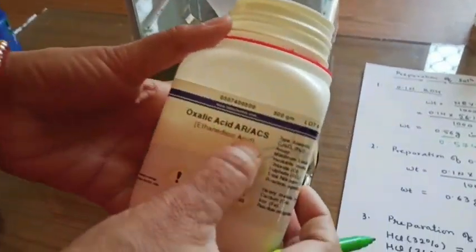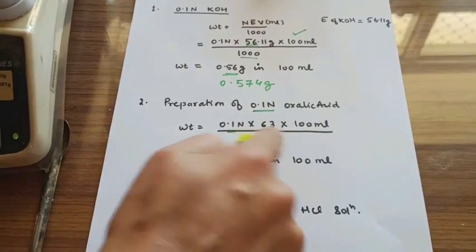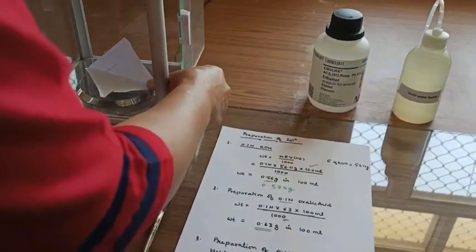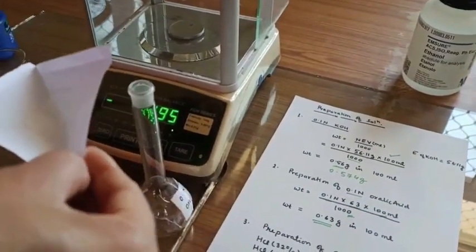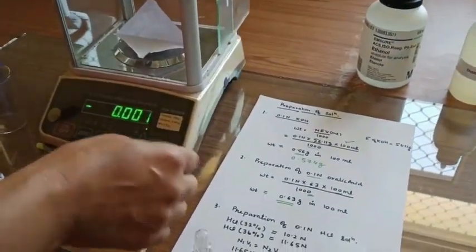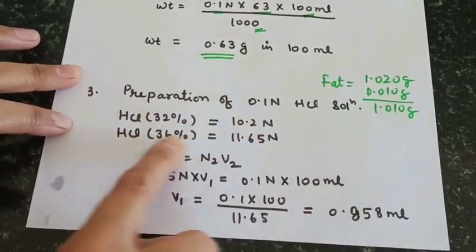Next is the weighing of oxalic acid to standardize the KOH solution. The molecular weight of oxalic acid divided by 2 gives its equivalent weight. To prepare 100 ml of 0.1 normal oxalic acid, we need to weigh 0.63 grams. We transfer it into the measuring glass with the help of a funnel, washing the paper thoroughly to ensure complete transfer. Oxalic acid is used as a primary standard, as I have explained in a previous experiment.